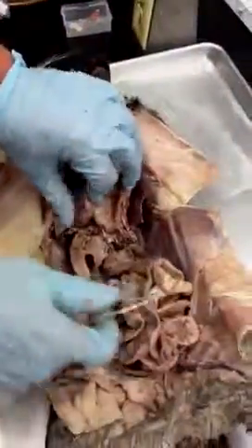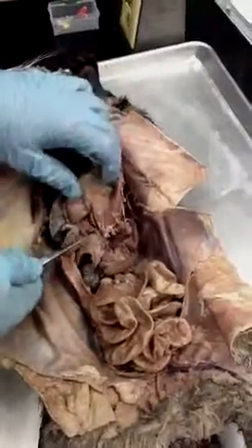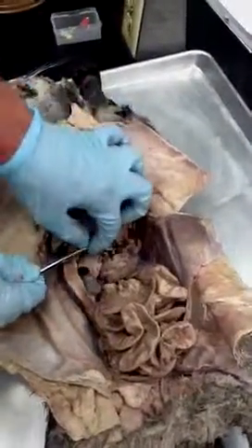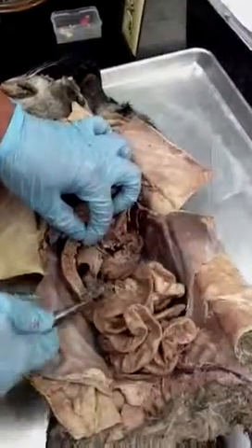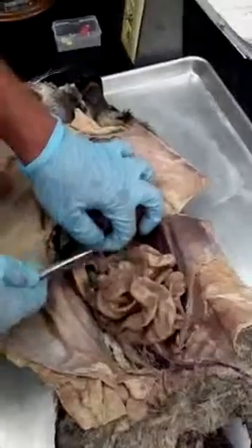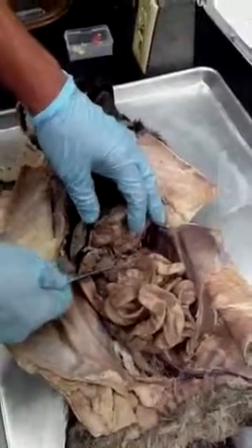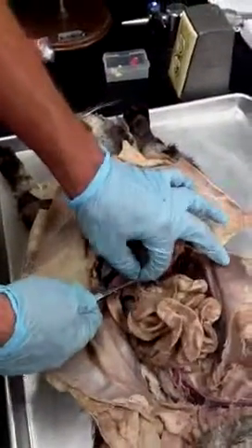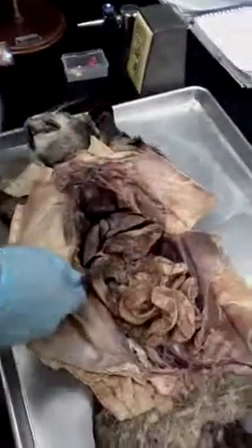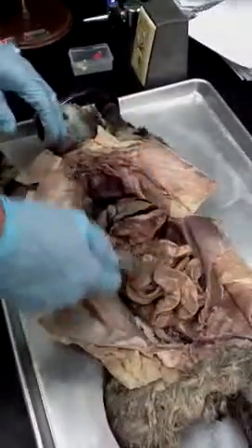The hepatic portal vein is cut off on this one, but that's the base of it right there. It would be running, it'd be right there, running up through the intestines to the liver. That's the hepatic portal. Yeah, it never takes the dye. It's always just an off, brownish color. So it never takes the stain, but it runs from the intestines to the liver.